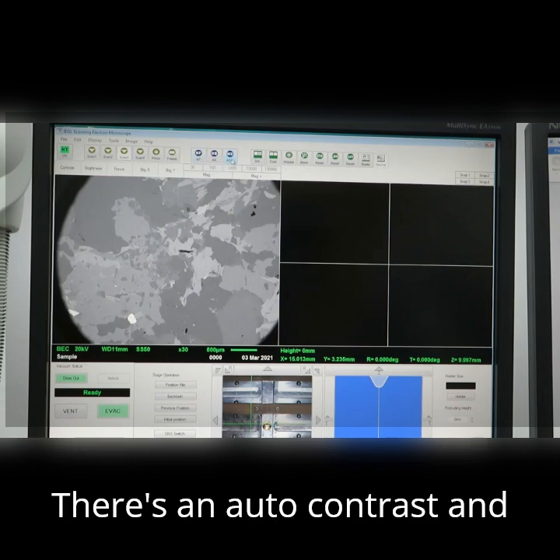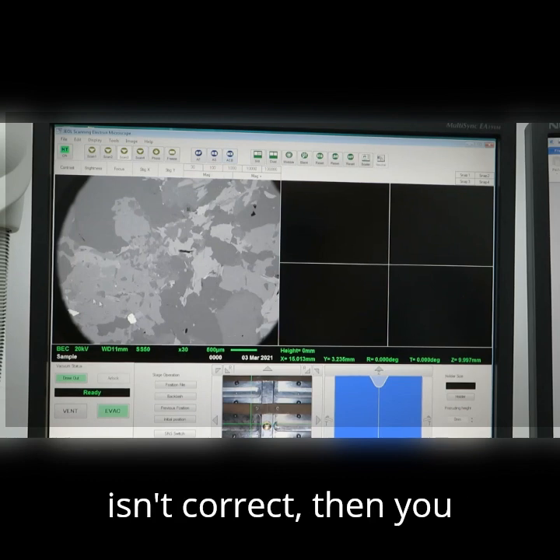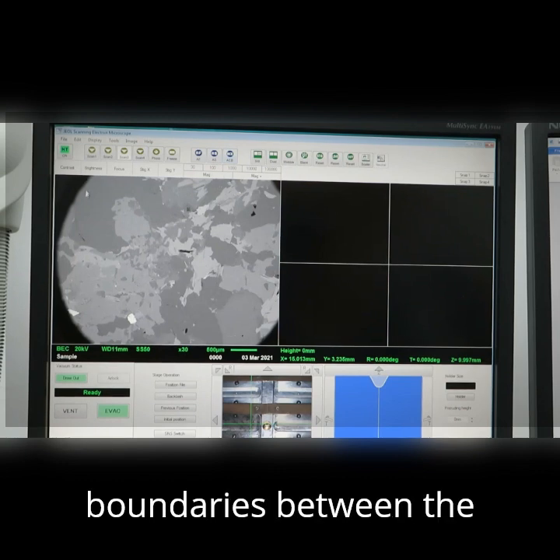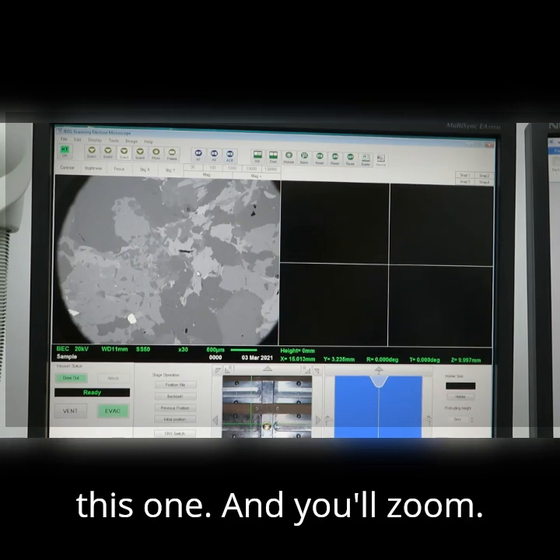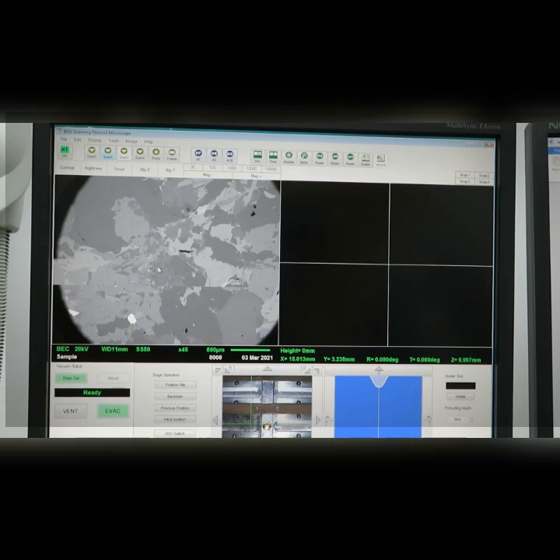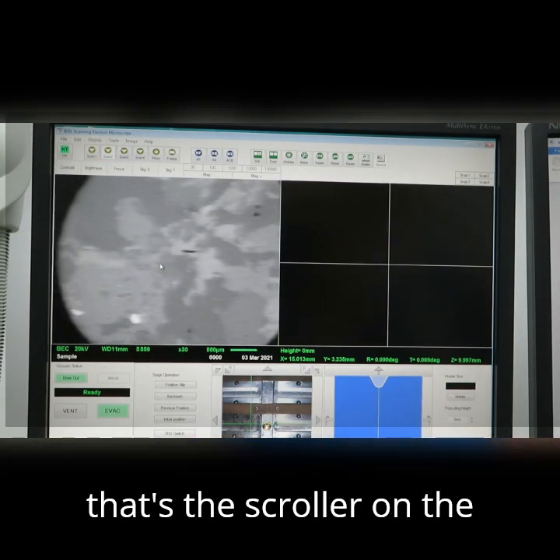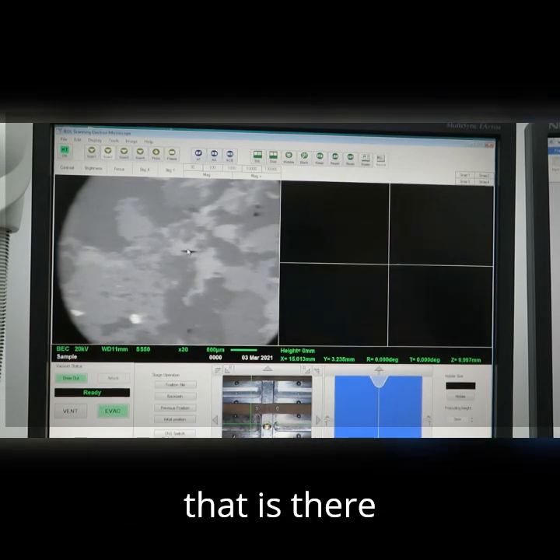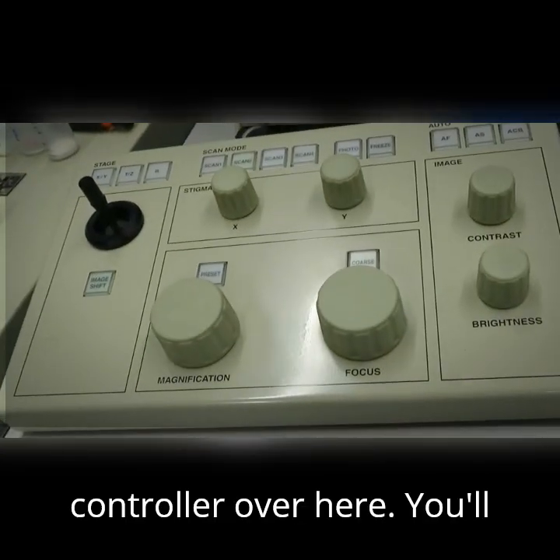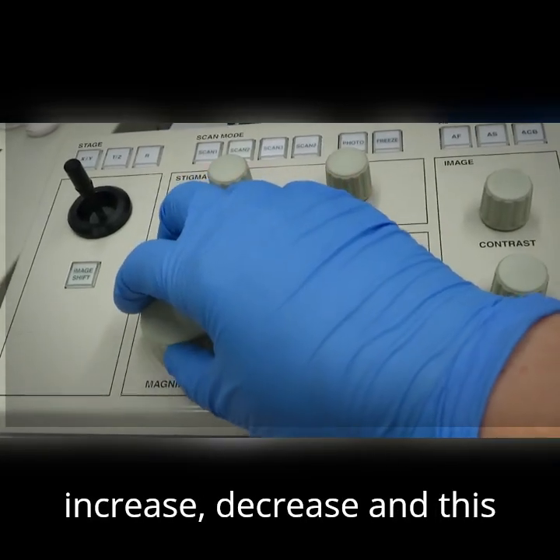There's an auto contrast and brightness. If the contrast and brightness isn't correct, then you aren't able to see the boundaries between the different minerals. I've already clicked it for this one, and you'll zoom. If I go to scan 2, you'll see that I zoom in and I'm zooming out. That's the scroller on the mouse. Another way is there is a controller over here. You'll see there's magnification, so increase, decrease.